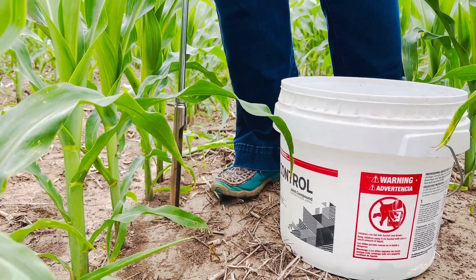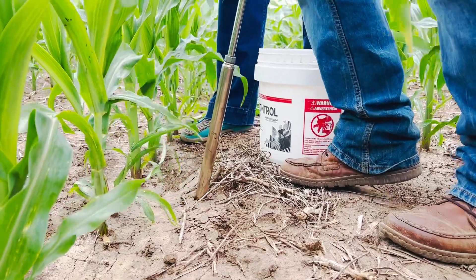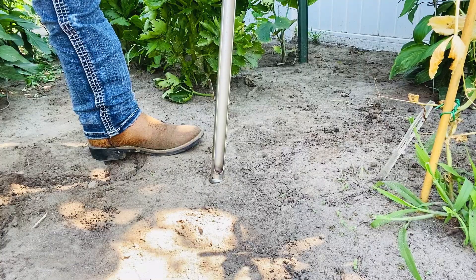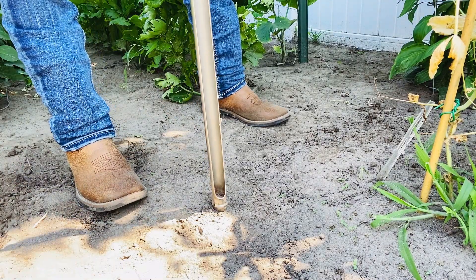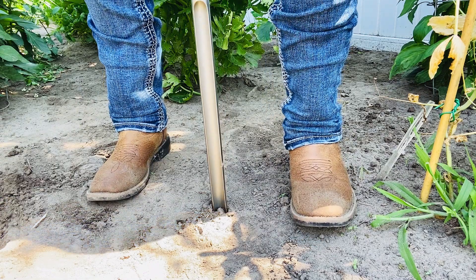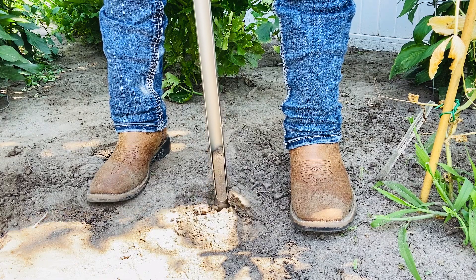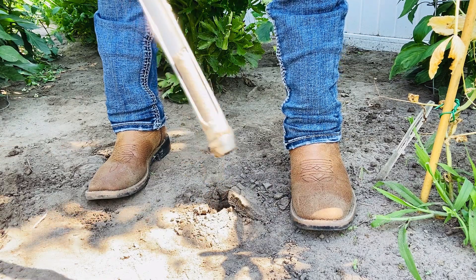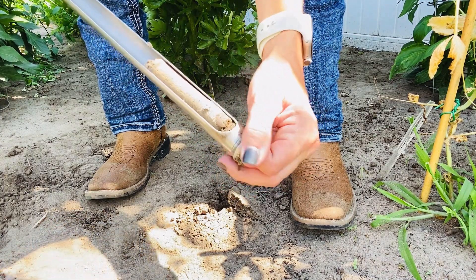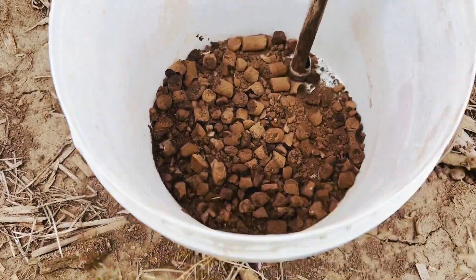The industry standard is zero to six inches. When obtaining the sample, clearing away crop residue is significant so the organic matter reading isn't falsely represented. Pushing the probe into the soil straight up and down is key to making sure the correct depth is extracted. Marking six-inch increments is also ideal if going deeper than zero to six inches. If the soil is sticking to the probe, WD-40 can be used as a lubricant and will not impact the results of a soil test.